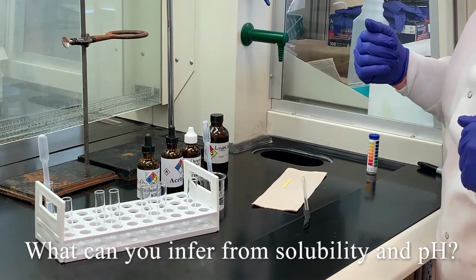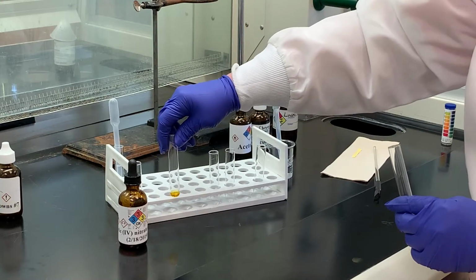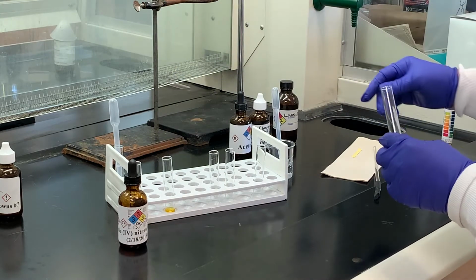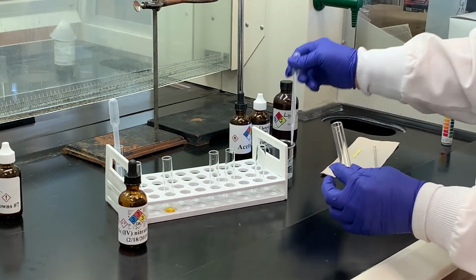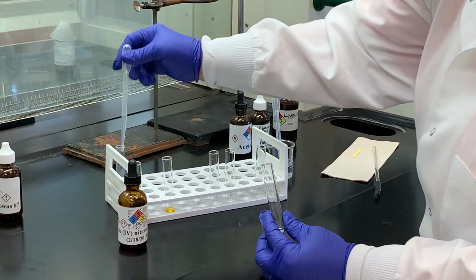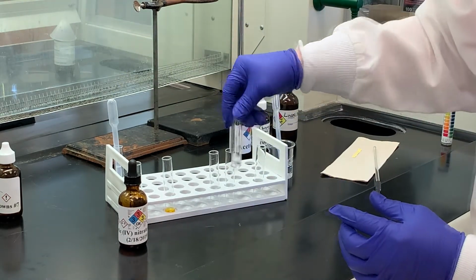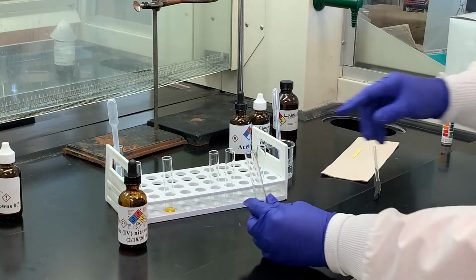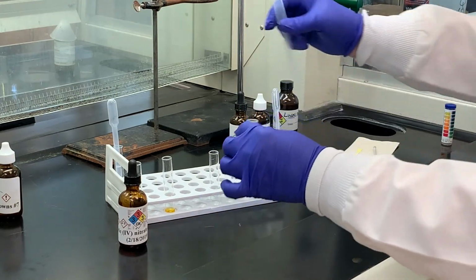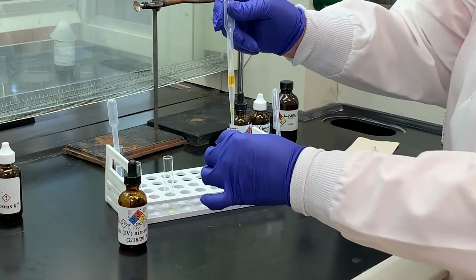Possible functional groups. The first test that we're going to do is the ceric nitrate test, and what I did was just to put some of that in the test tube so you can see the color of that. And then I'm going to take a little bit of water, put it into a clean test tube, and then add a couple drops of my unknown and mix that up. And then I want to take a drop or two of the reagent and put that in there and see what happens.